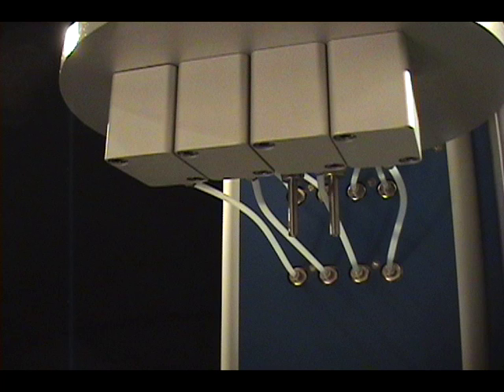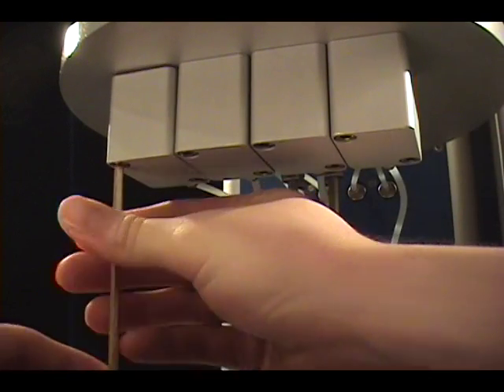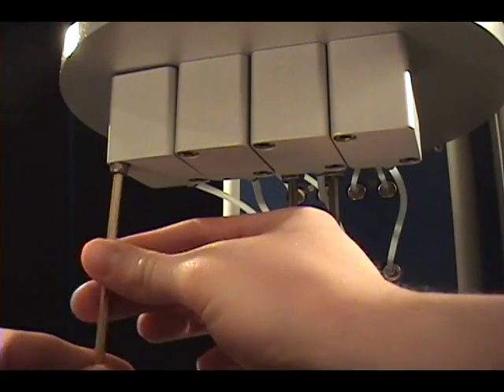On the underside of the bath, each tube has a corresponding aluminium mixing chamber, which ensures that the sample and the injected solvent are thoroughly mixed, preventing a sample from becoming solid as soon as it leaves the thermostatic bath. To remove the mixing chamber, simply remove the two screws holding it in place.